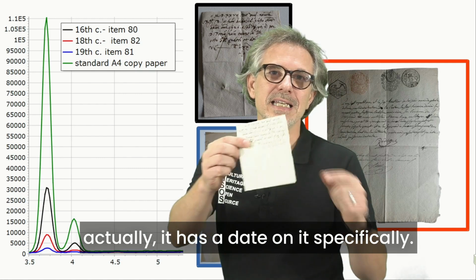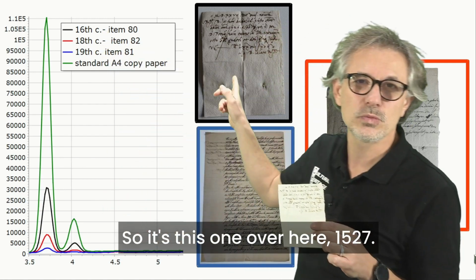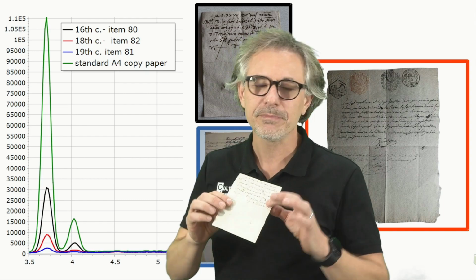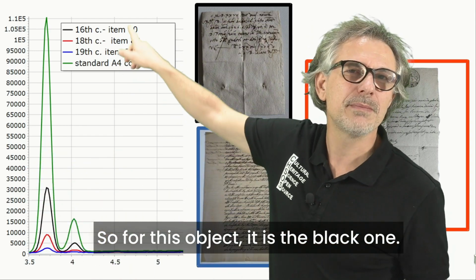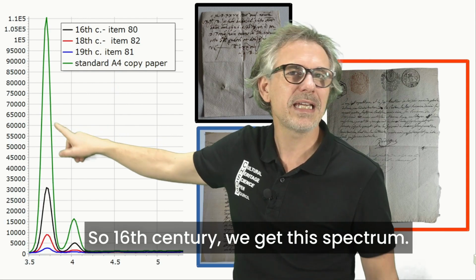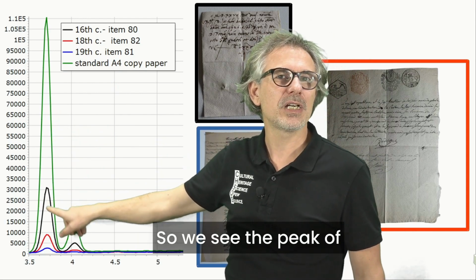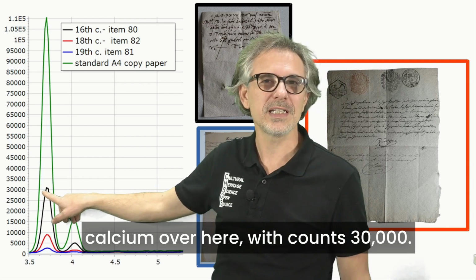Actually, it has a date on it specifically, 1527. So for this object, the black one, 16th century, we get this spectrum. We see the peak of calcium with counts of 30,000.